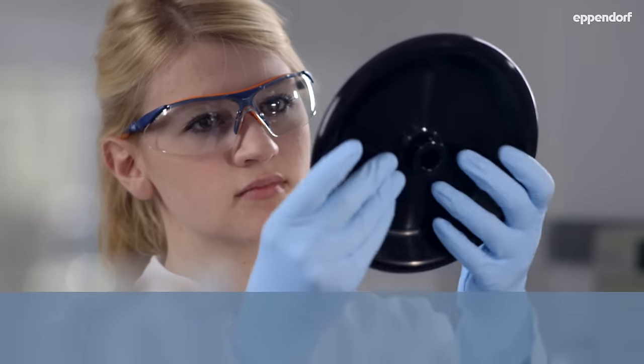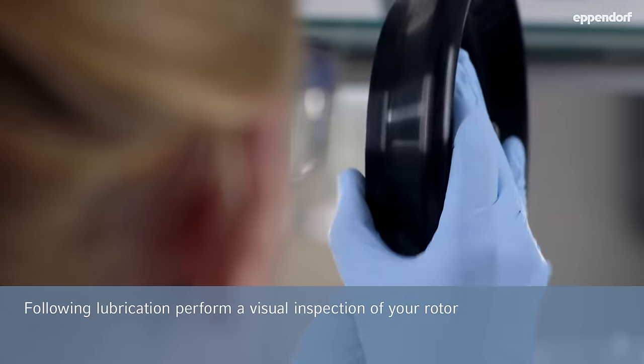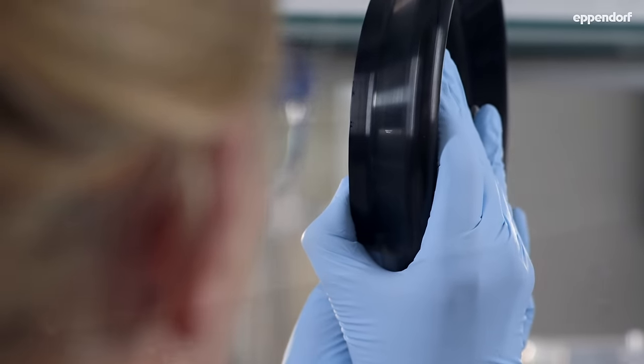Finally, inspect your rotor closely for small cracks or corrosion. If there is any rotor damage, we recommend replacing the rotor immediately.